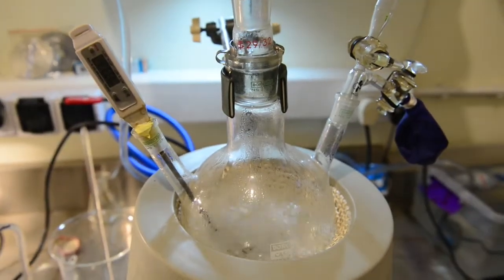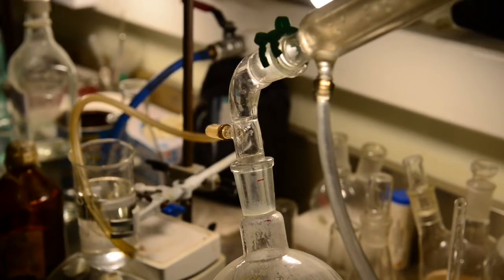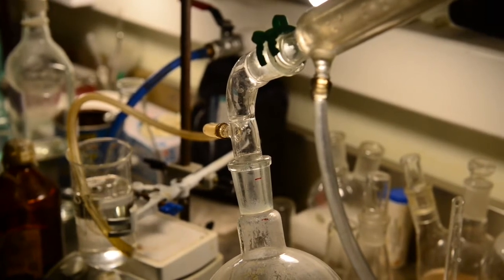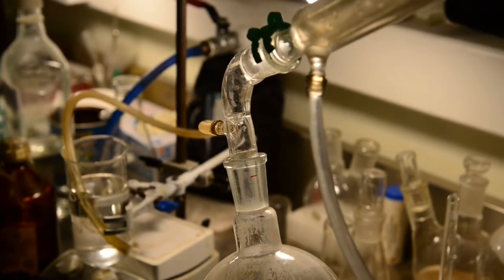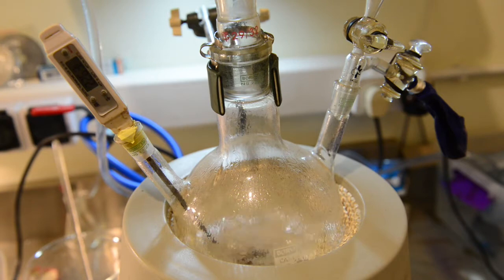Above 120-133 degrees liquid starts to boil vigorously and some quantity of distillate is collected. This is mostly formic acid. Some sources are suggesting to change the collecting flask after this point. The formic acid could be reused for the next run, but we are simply going to collect everything. There is just a little evolution of CO2 gas at this time.